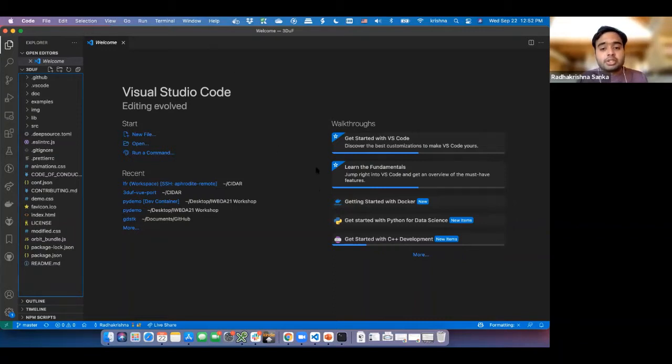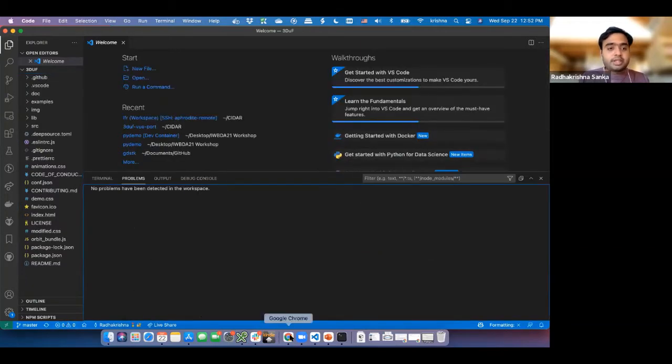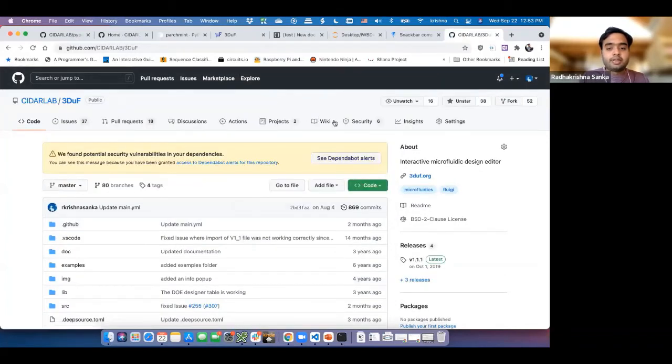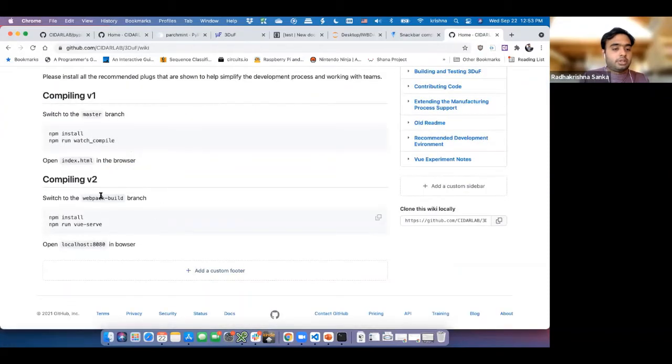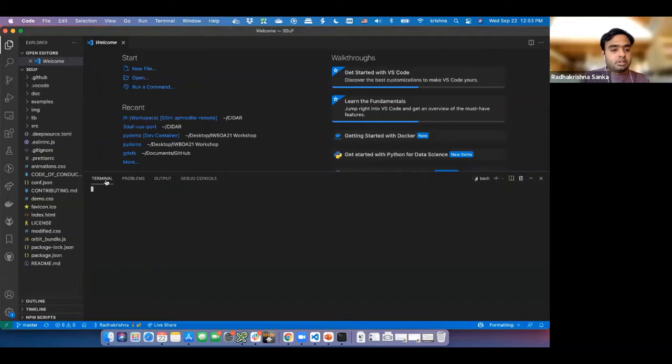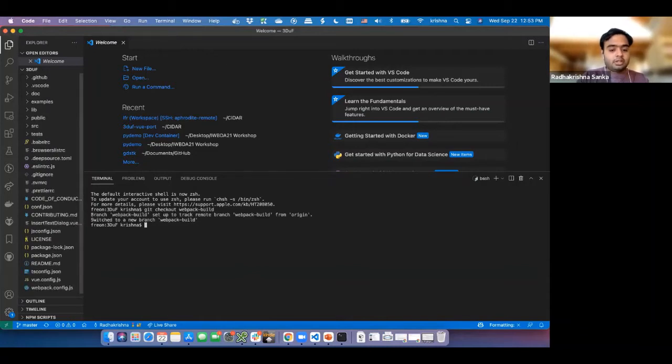Now, the first thing you want to do is, I see another message over there. You should follow the V2 instructions. Yes, thanks, Kenza. So as I said earlier, let's just follow the V2 instructions here. Basically, it's nothing but npm install. I have all the other things installed, so it should be fairly simple. But first, I need to switch to the right branch, right? Git checkout, webpack build. And then I'm going to hit npm install. It's going to install all the infrastructure, all the JavaScript libraries and everything that it needs for you to run this.